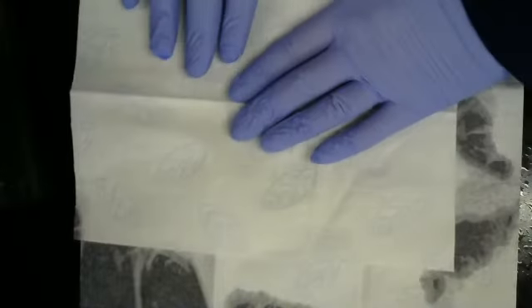Next thing we're going to do is we're going to take some paper towels and simply lay the paper towels across the spill. We are then going to let this sit for 10 minutes.